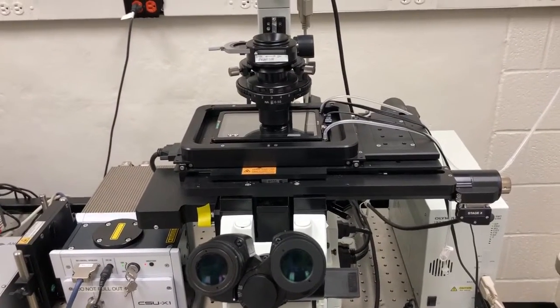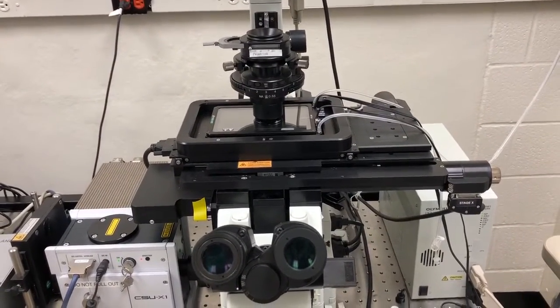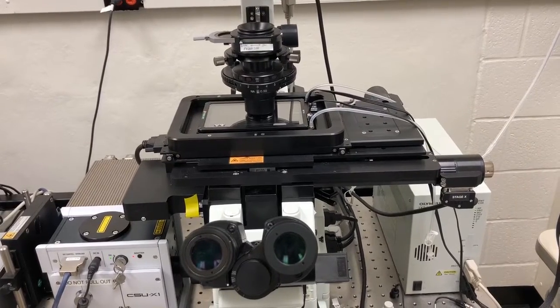Once we're done looking by eye, we have to take a series of steps to ensure that we can look at the sample with the spinning disk confocal.